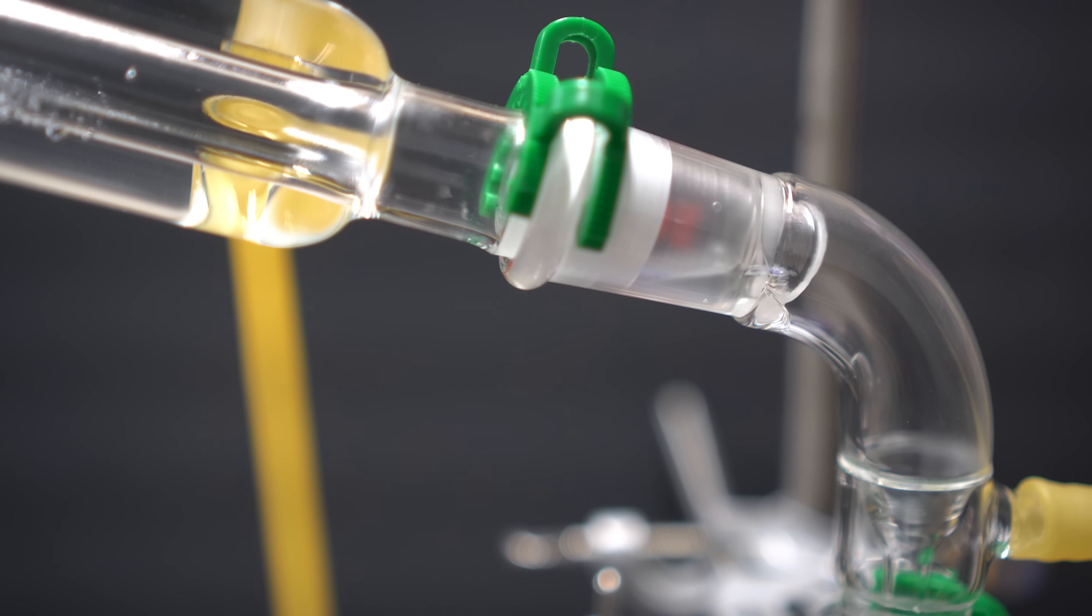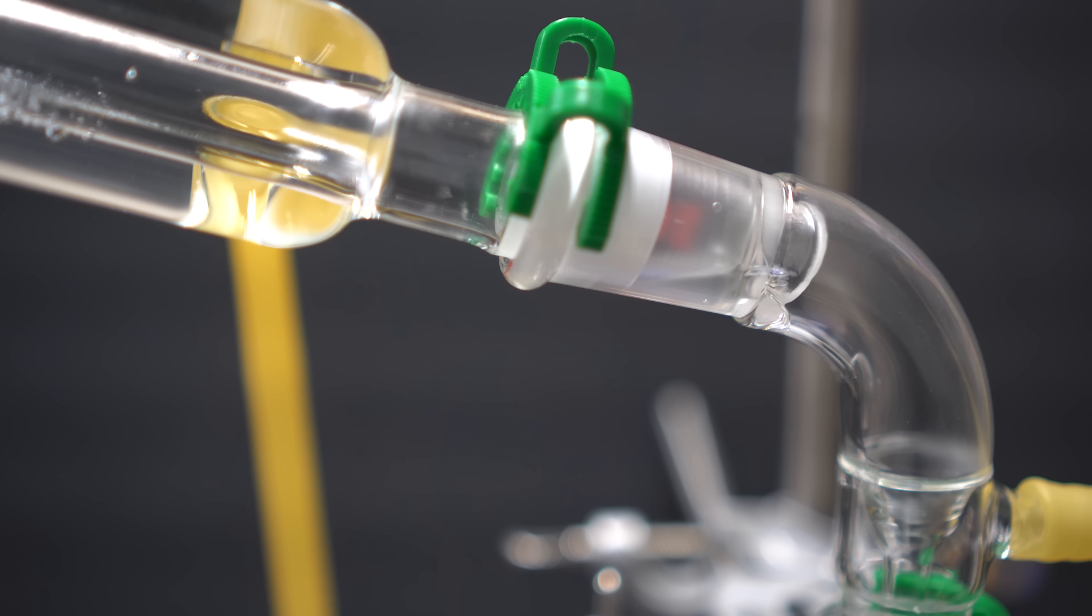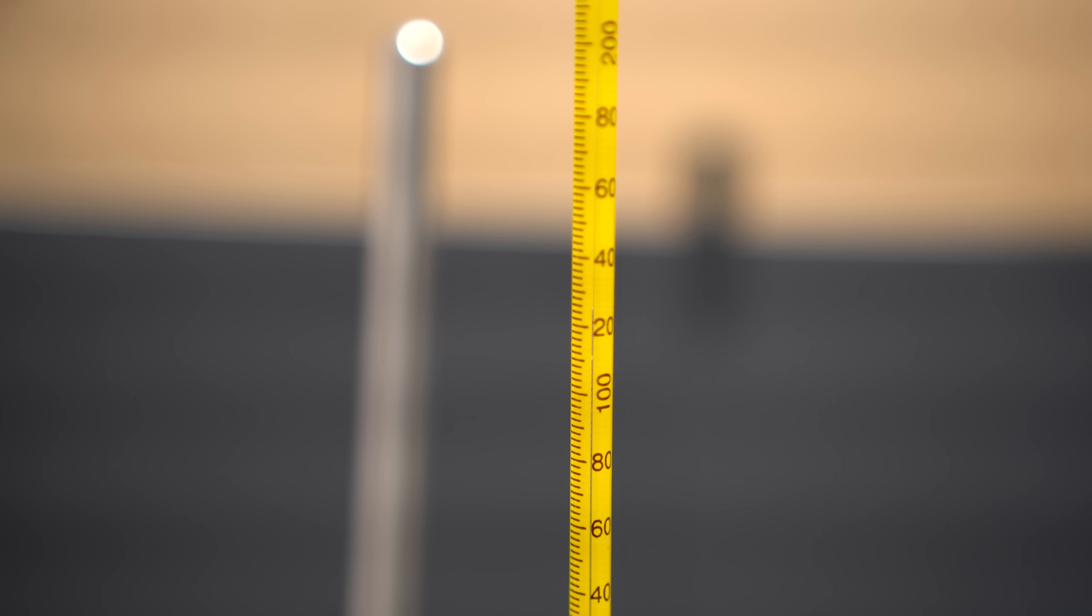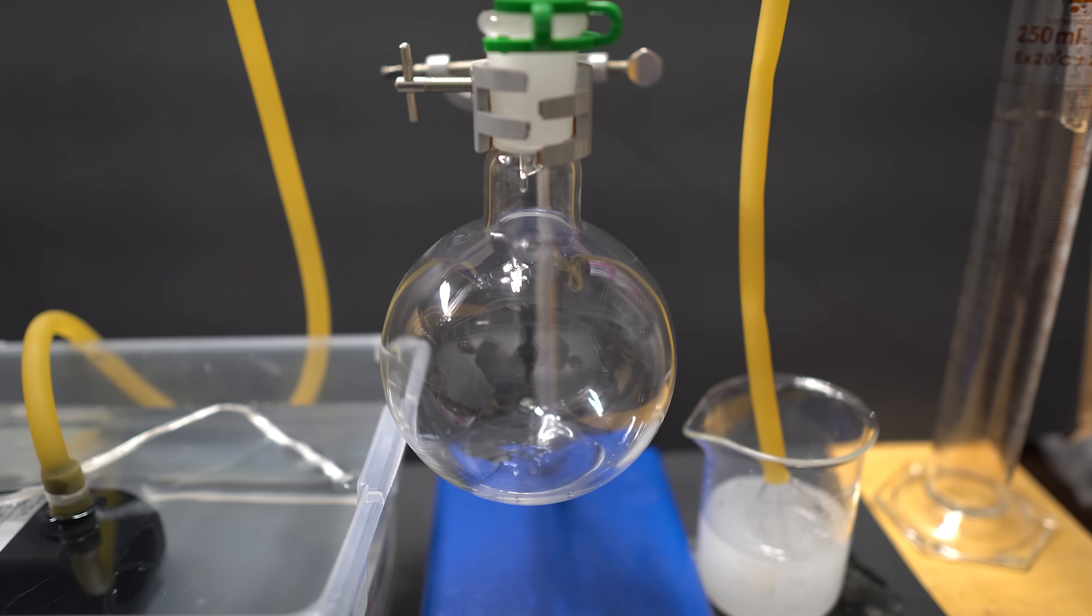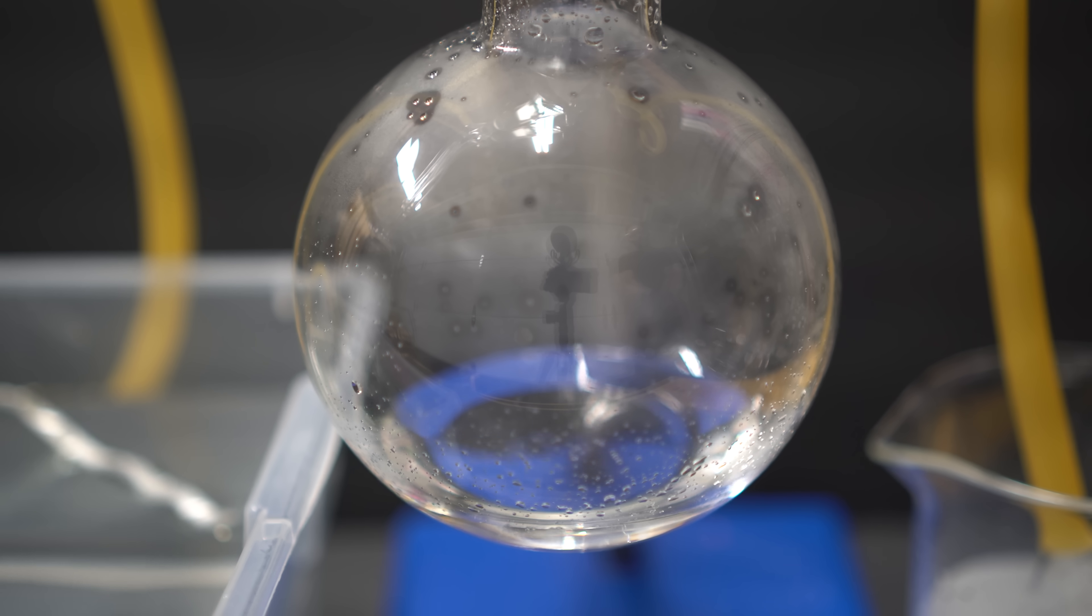Though, mine really didn't just start coming over until about 124 degrees Celsius, which usually happens in a lot of my videos. I promise I'm not faking them. Here, you can see it's at 124. Now, here's also the start of the distillation, and you can see that the liquid coming over is quite clear.